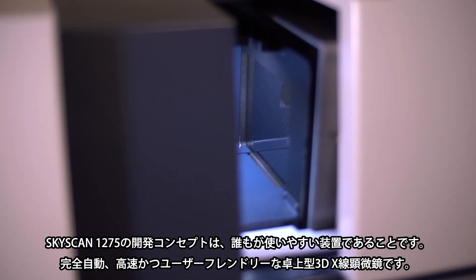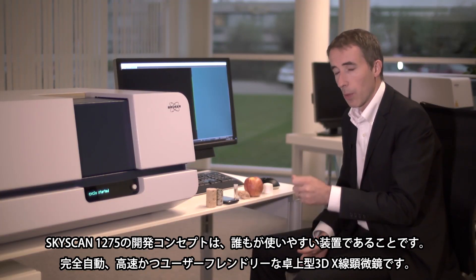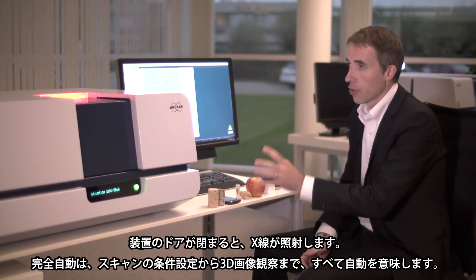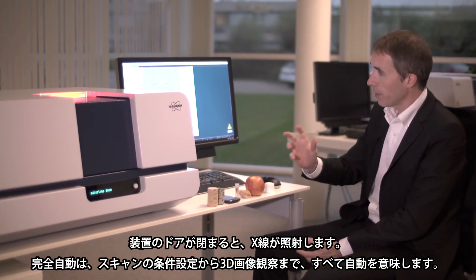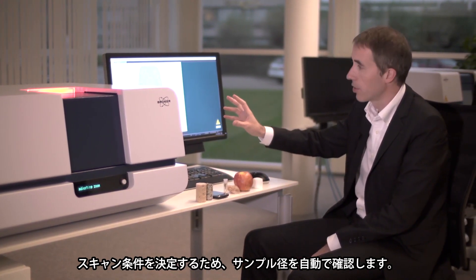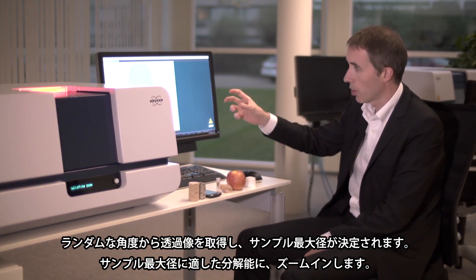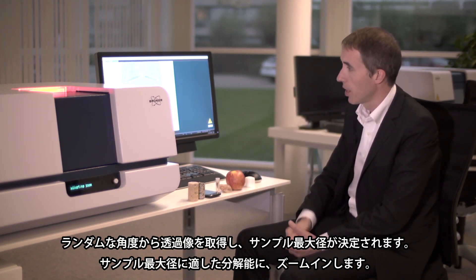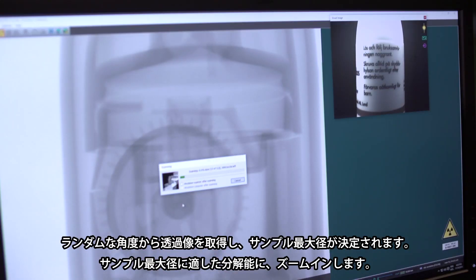When the scanner was developed, key features are that we wanted it to be extremely user-friendly and also very fast. As soon as the door is closed the x-ray source will turn on, and one of the nice features of this scanner is that it will automatically detect the size of the object, and by rotating at different angles it can look for the maximum diameter of the specific object and zoom in to the maximal desired resolution.